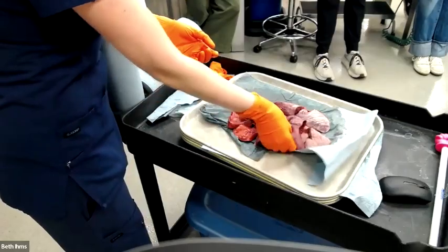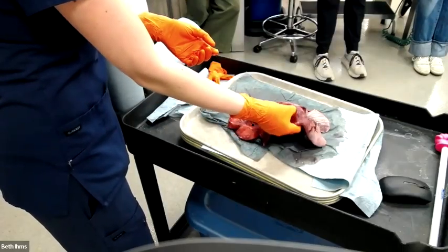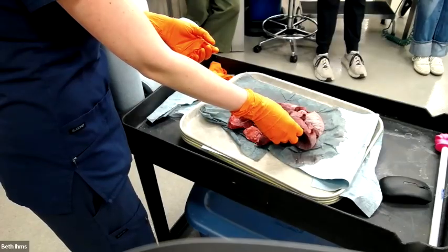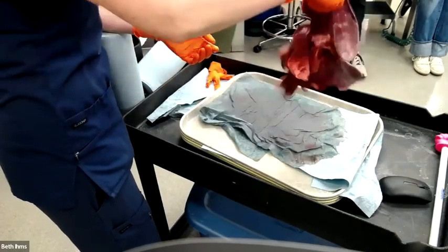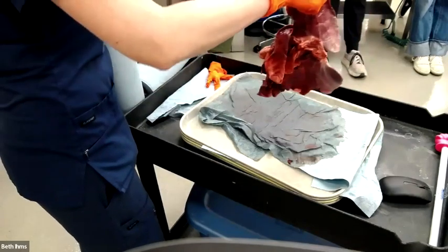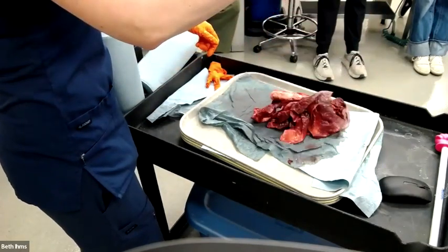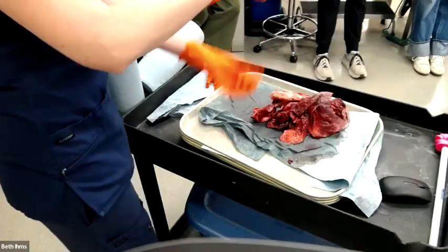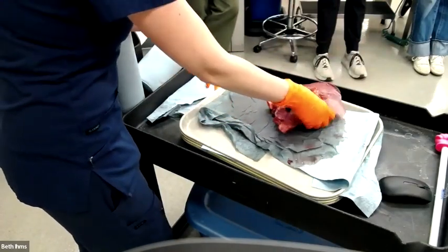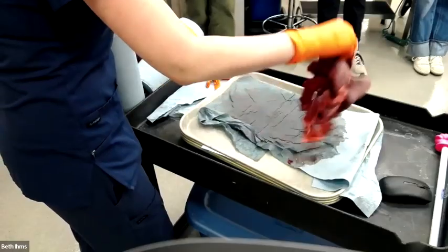I would not use friable. I don't think this lung is falling apart. In fact, the lung, if you think about the normal microanatomy of the lung, it's a lot of collagen, elastin. It's pretty tough. So if I can pick you up by your tissue and shake you, you're not friable. If I did that to that liver tumor, I would end up with like a little pinch of liver and it would just be like, no. So it is not friable. It is soft, but it is not friable.